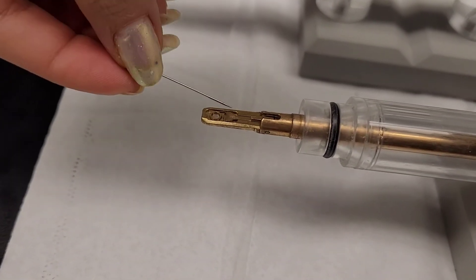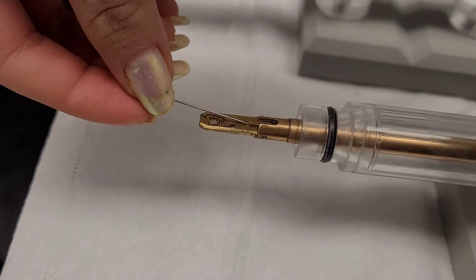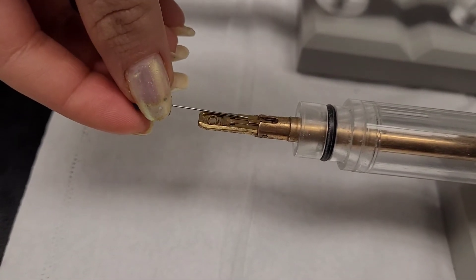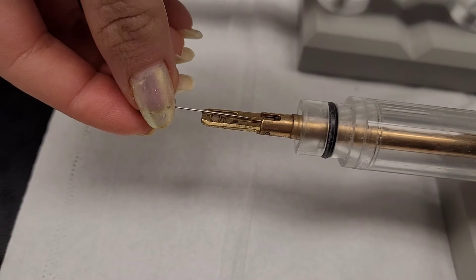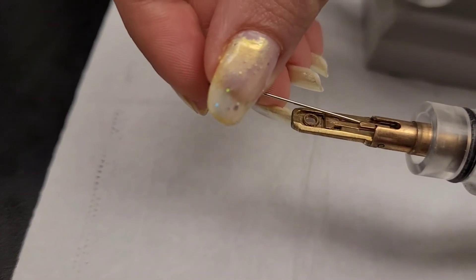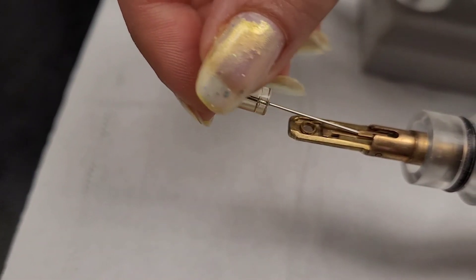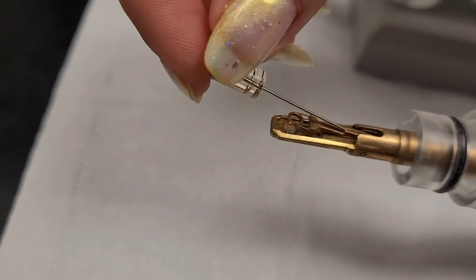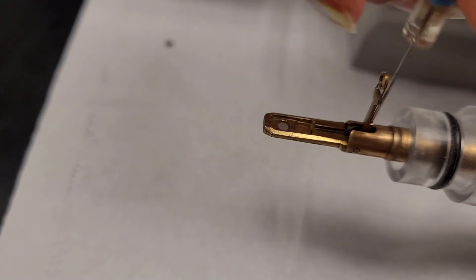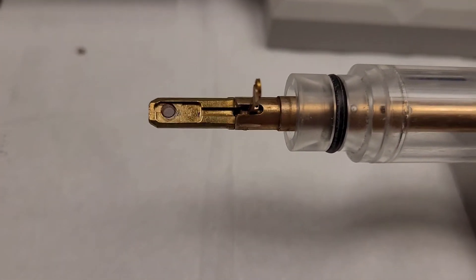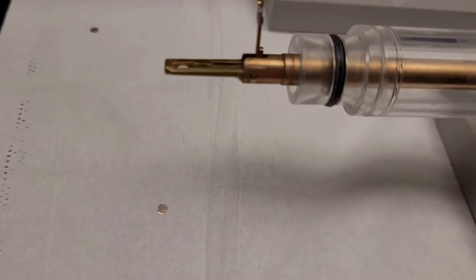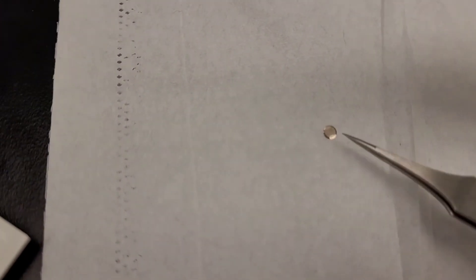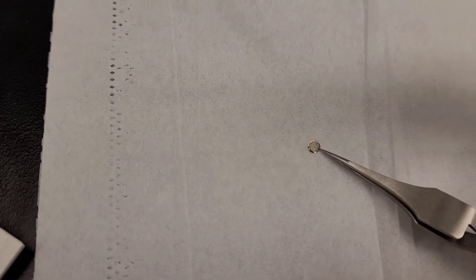That's the tricky part, I would say. To remove your grids, you use the little pin to move the holder up and you just flip it, and your grid will fall down. Then you can pick it up carefully with the tweezers and place it back in your specimen holder.